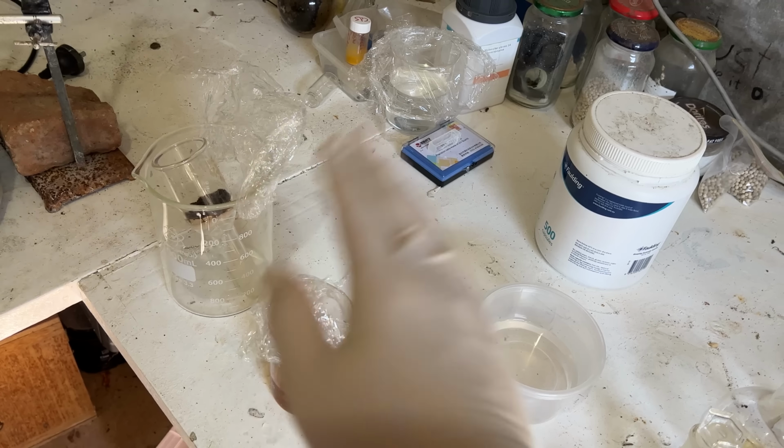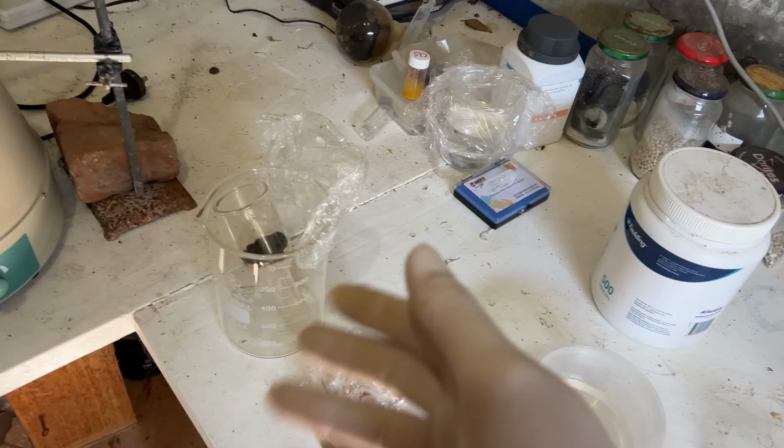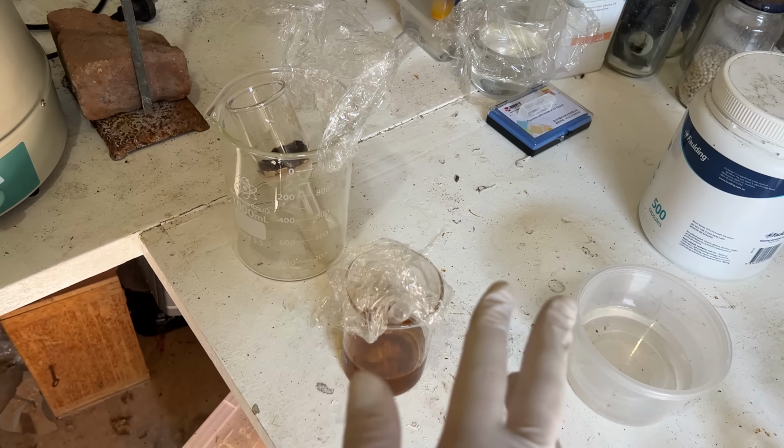Well, it won't mix, it'll separate out, but all the cubane will dissolve into the DCM, and then we can evaporate the DCM and we're left with our cubane. Why it hasn't precipitated out, it's strange. It's strange, but it's probably because I used just far too much water.